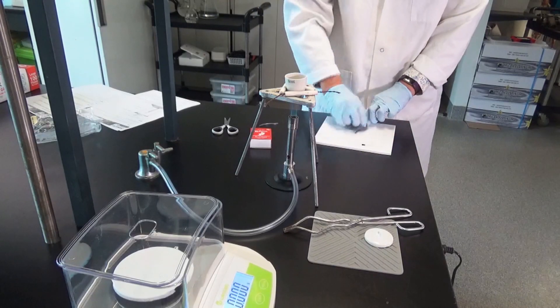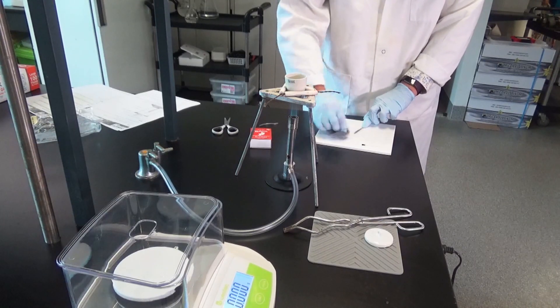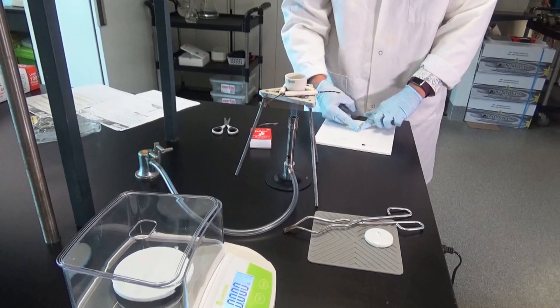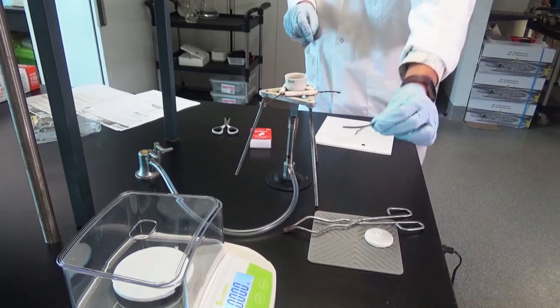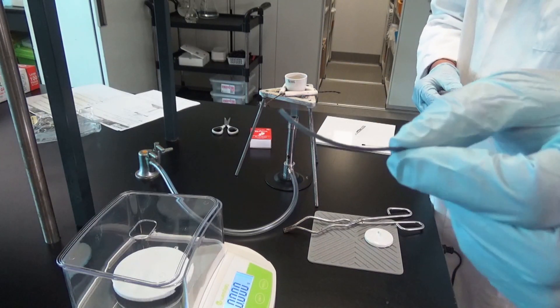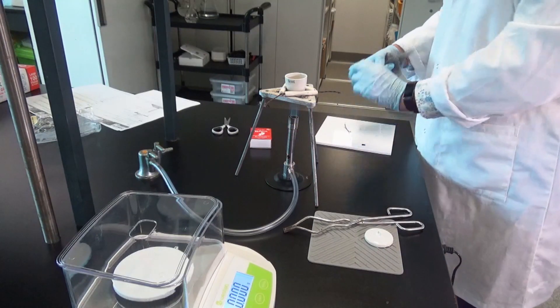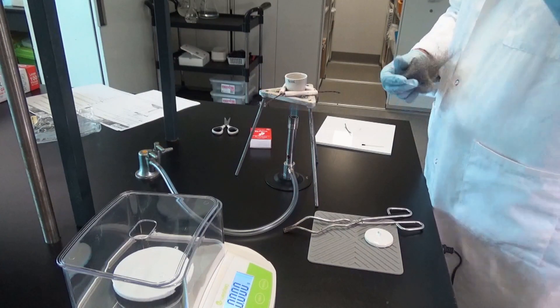So what I'm doing at the moment is cleaning off the outside of the magnesium because when you get magnesium it has this nice little black coating over it. The magnesium has a coating on it and the idea is to clean it so that it no longer has the coating.